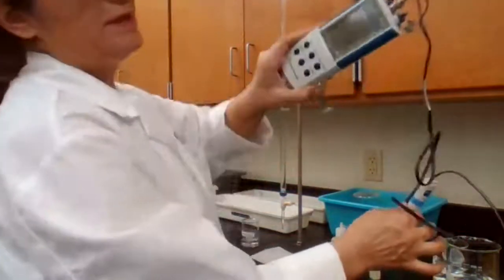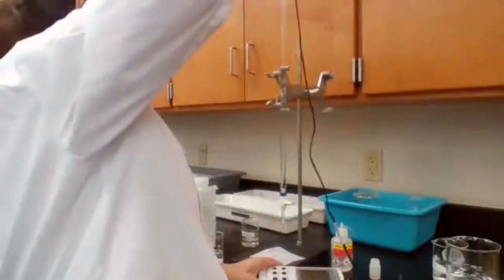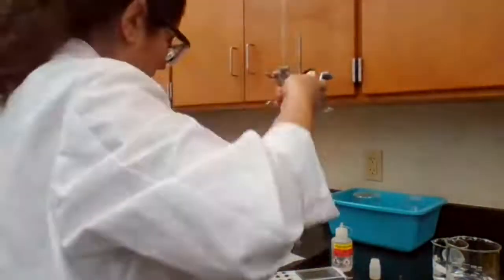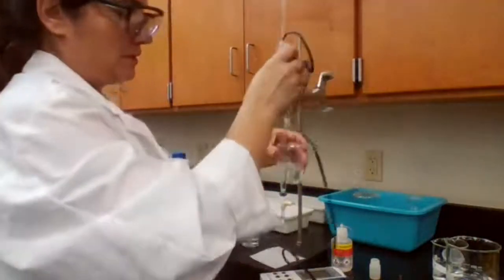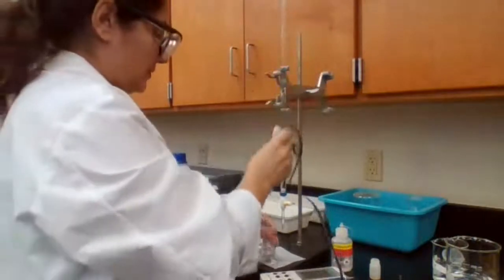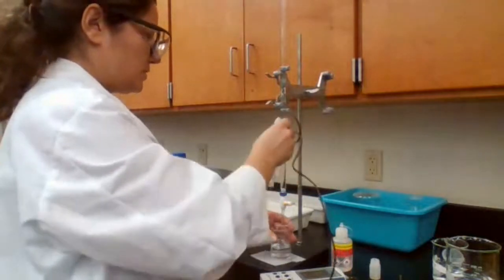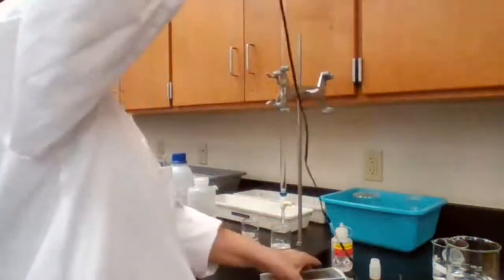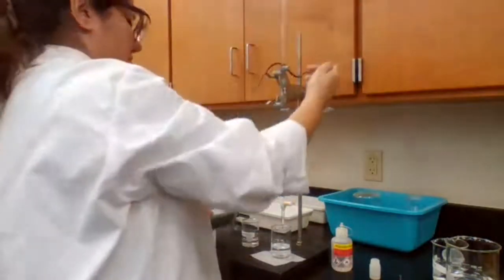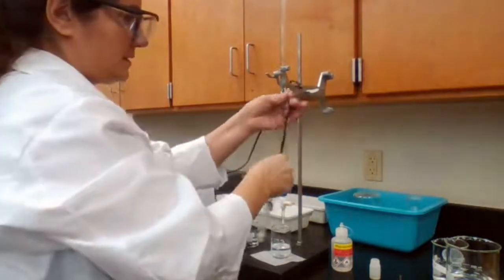So now it reads the pH as 7.01. That means that if I put in another solution, it is going to read the pH more accurately. Okay. I'm supposed to place the pH meter into the acetic acid, add the base, and record the pH. Because it's heavy, it might tip the beaker over. So I'm just going to utilize this burette stand and hold it, put the weight on the burette stand so it doesn't.